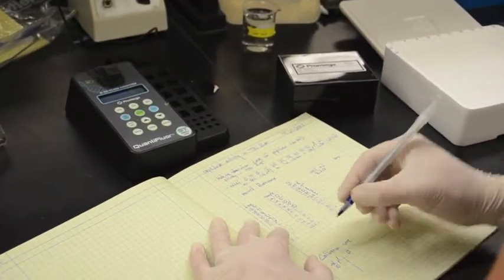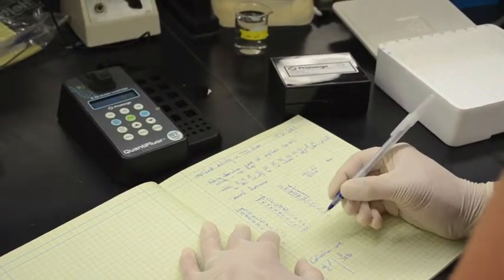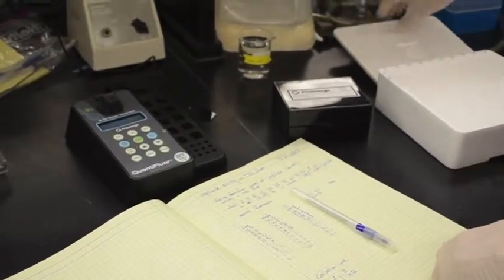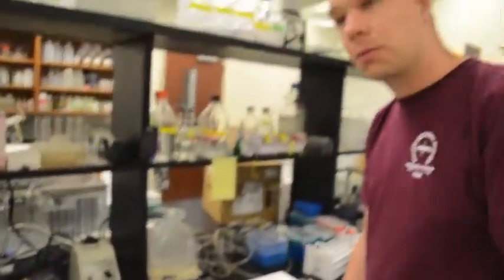10 microliters, and the fluorescence is 7,036. Again, we'll want to do this with maybe 5 different concentrations so we can get a linear curve. But the specific concentrations are not the most important thing in the world. The important thing is that the fluorescence values that you measure span the approximate range of fluorescence values that you have in your enzyme experiments. So these enzyme experiments started out at fluorescence values of about 200 or so, and they're going to probably go all the way up to maybe 10,000 or 20,000.